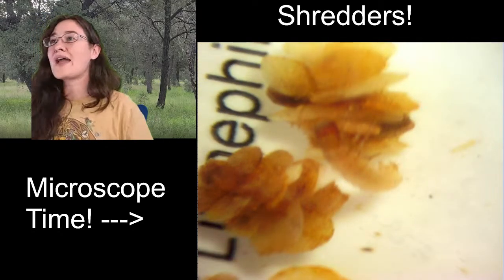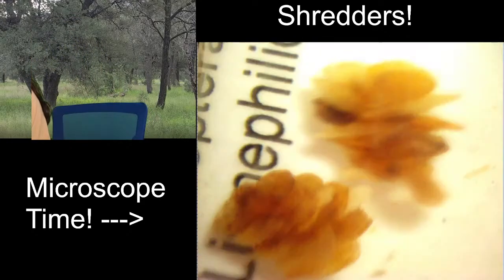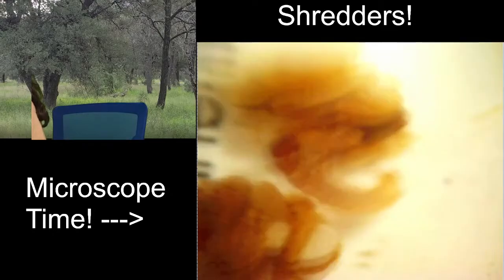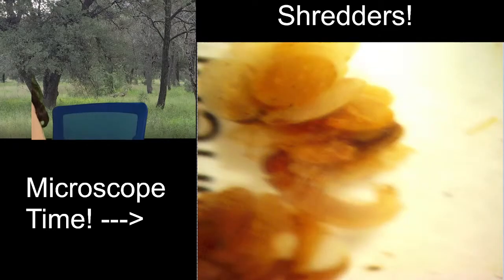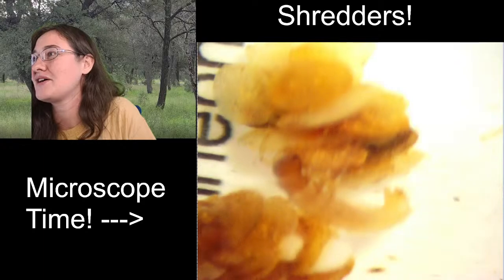So I am just leaving my specimens in the vials that they are in, but we can see our friend and the home that it built.